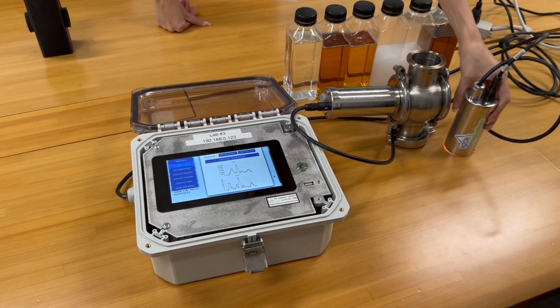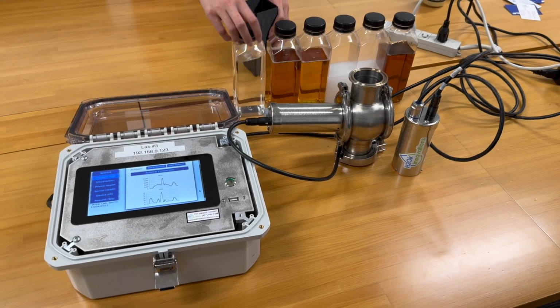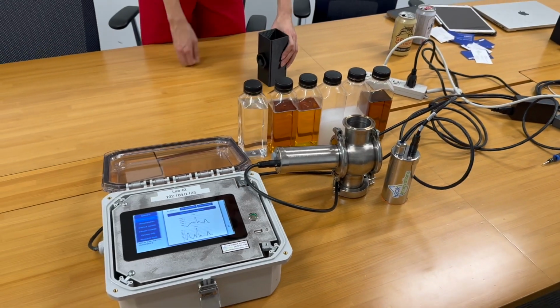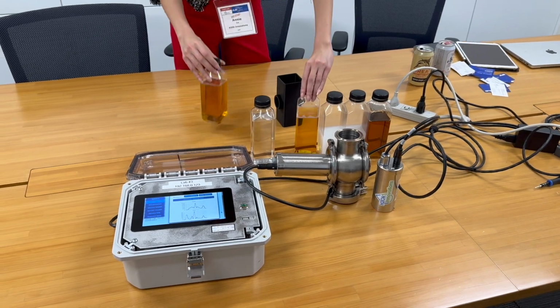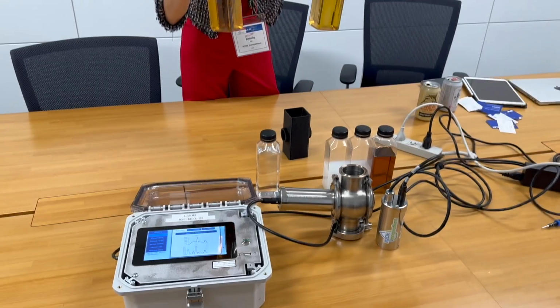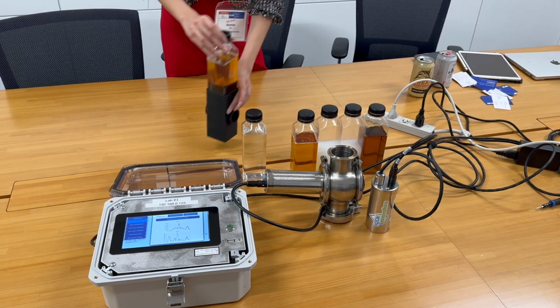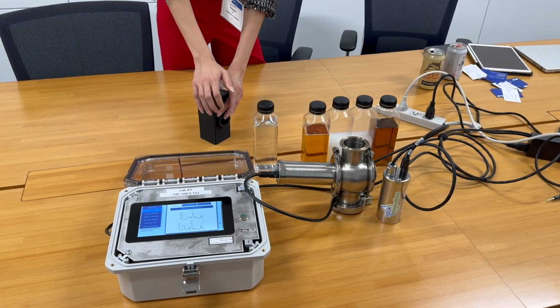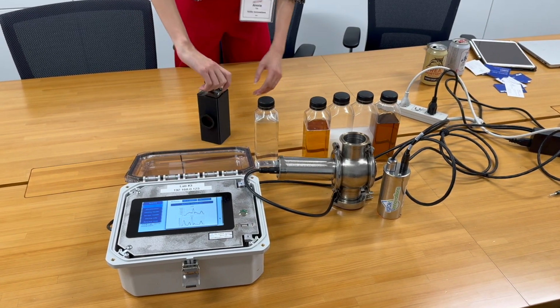And what's really interesting now is, let's just take some different use cases. If you want to look at product quality and changeover optimization, we have just two different off-the-shelf beers. And you can see the differences. If you're doing a changeover, you stop production of this one product, you water push, and then you start production of a new product.